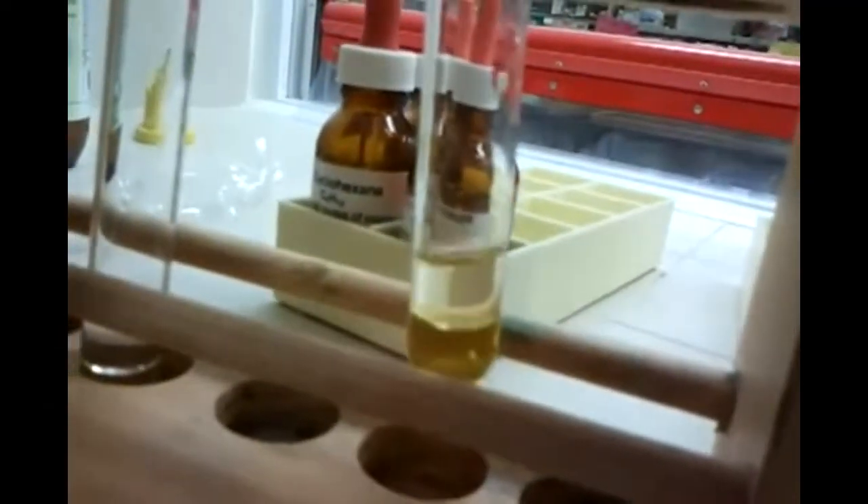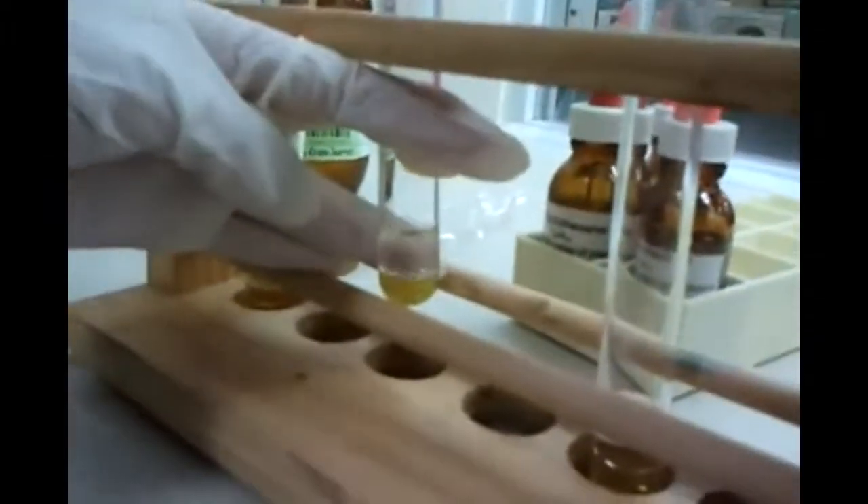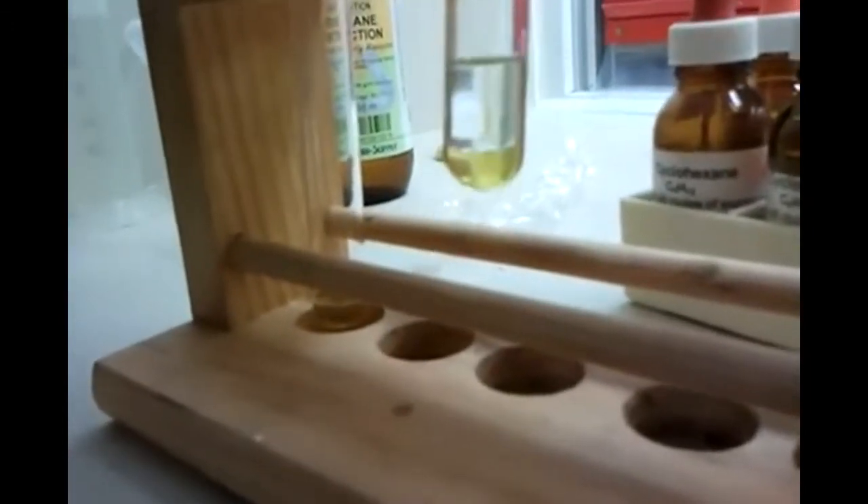Put hexane in this one. I put hexane. Hexane with hexane. Okay. Did you want to lift it up? They're not reacting. This is not meant to do that. How did you do that wrong? You get two completely separate layers. It seems to be the reaction. Is it meant to do that? Because we're getting it in here — the hexane, the hexane, the cyclohexane. We're getting something. We're getting a reaction. It's not focusing. There were bubbles. It was bubbling. Some bubbling.